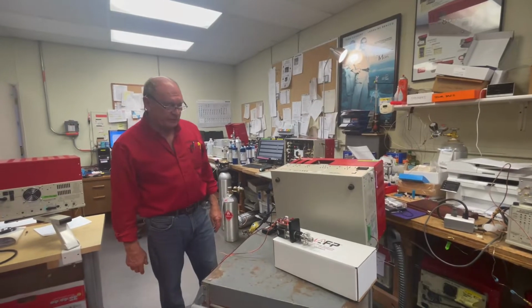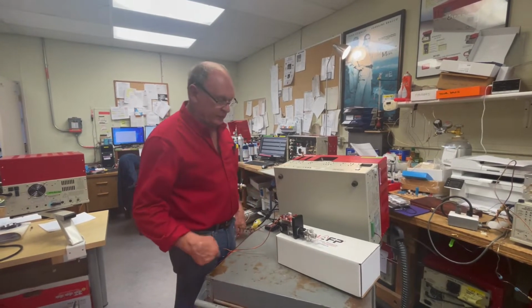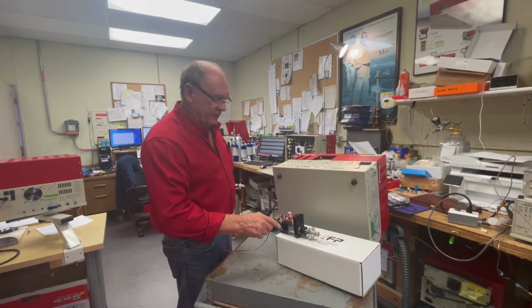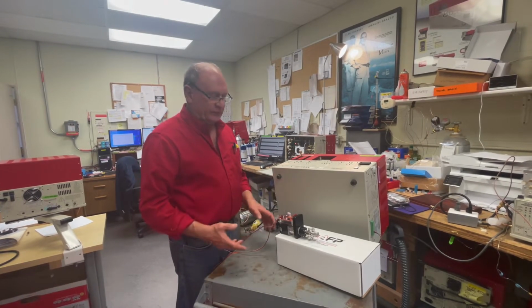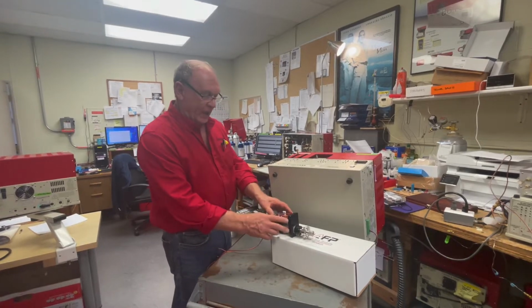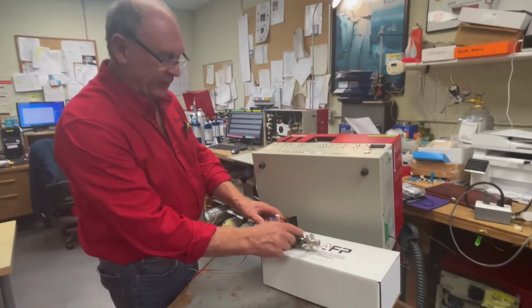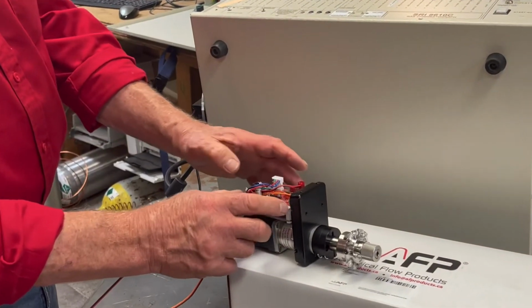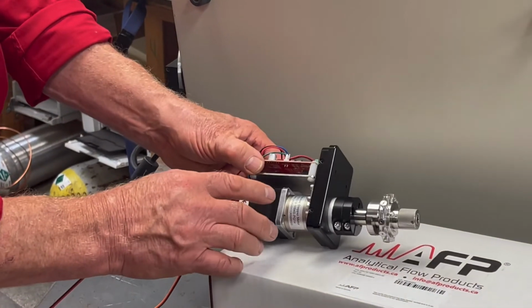My name is Hugh, and in this video we're going to talk about how to configure gas sampling valves. In the old days, this really wasn't necessary because the actuator, the thing that turns the gas sampling valve, this is called an actuator. It's a motor and then something to control the motor. These kinds of motors are called stepper motors.